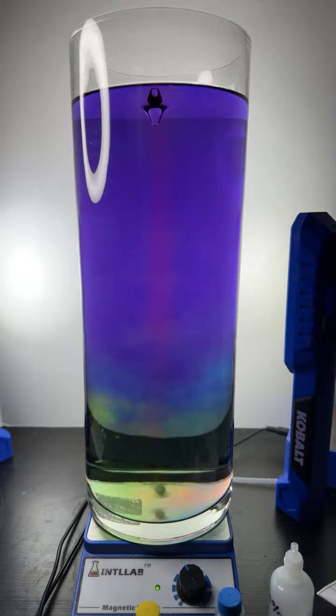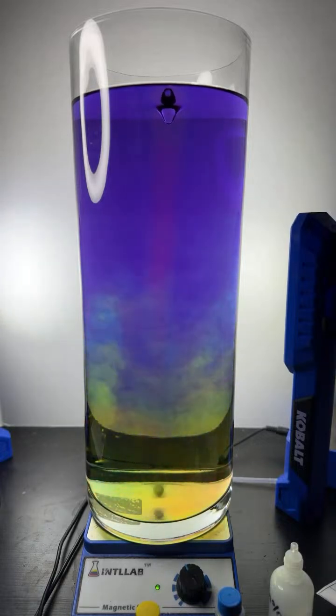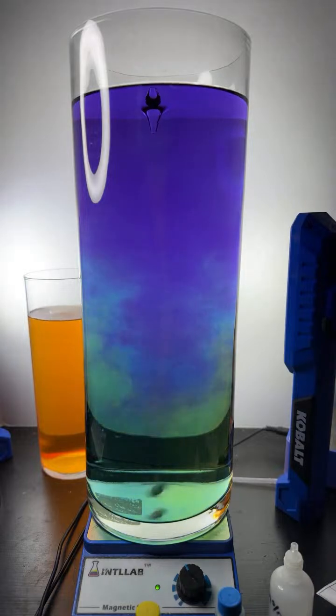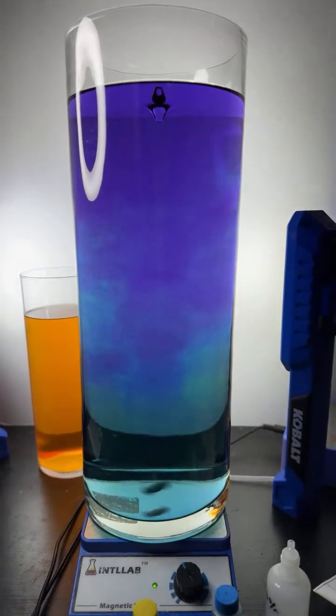This is a really large flask. So if you've seen the live before, this flask is much larger than what I normally use. Here's the normal size flask. That's about a quart. So that flask I'm sticking down there, that's about a quart. So, this is a really big container here.